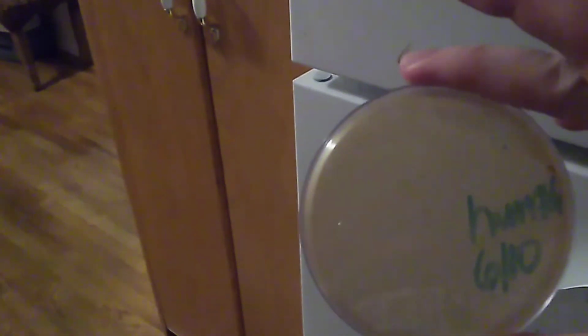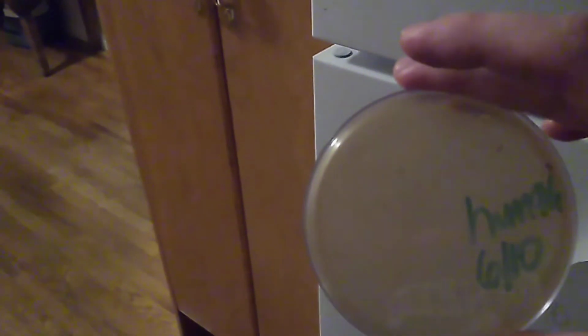So I was able to test right here. This is a modified hektoen from an undisclosed place. So I'm gonna grow those for a couple days, probably a week or so. See if anything grows. Okay, bye.